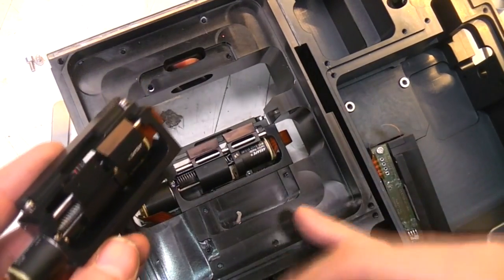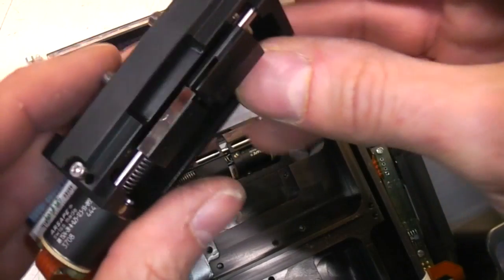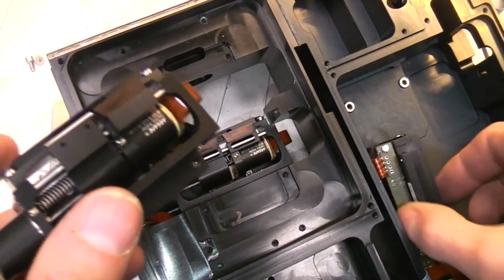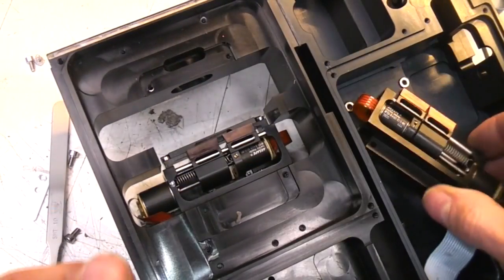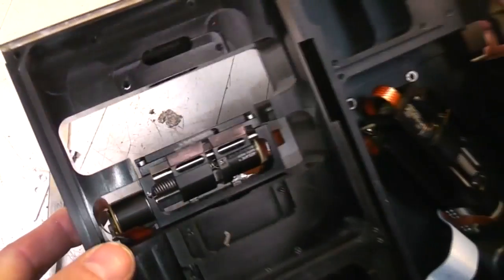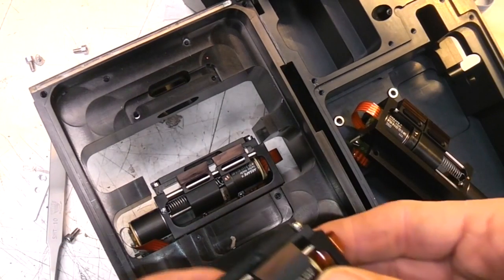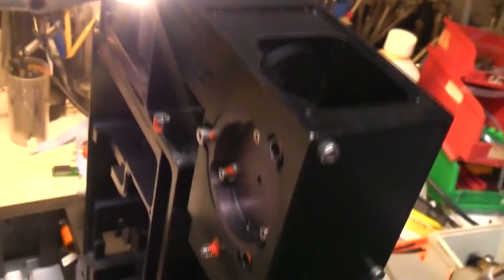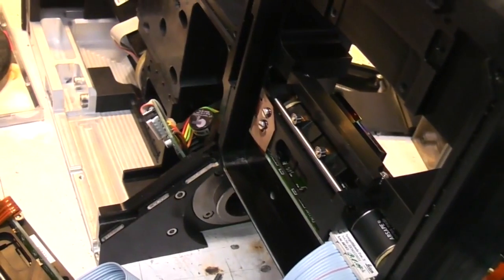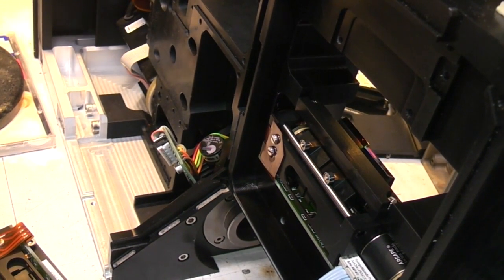I can't quite figure out the exact optical path here, but this one's got 2 sort of slopey mirrors, and this one, they're parallel. And I think this other one down here is also parallel, but the fact there's 3 of these and 3 photomultipliers, I'm sure there's one for each. Okay, I've finally figured out how this works. I'm just shining a super bright LED through here, prism back in, so we can actually get a spectrum. These just happen to be in a sensible position to actually produce something.